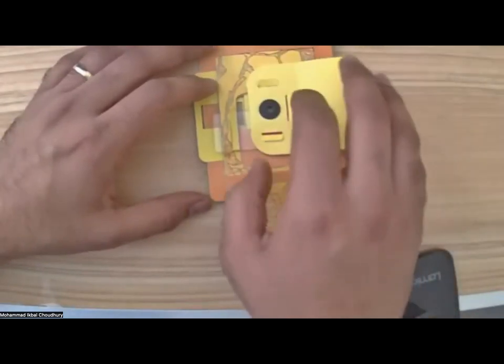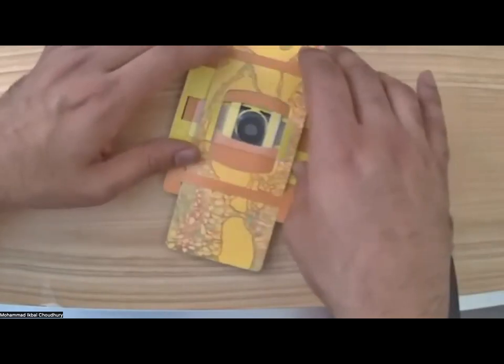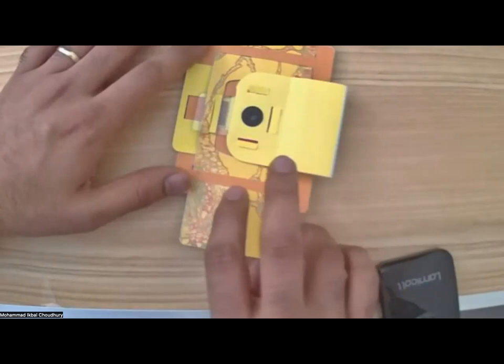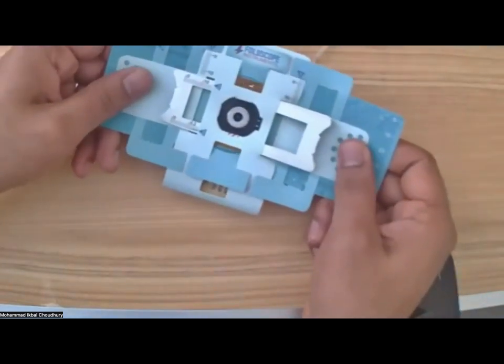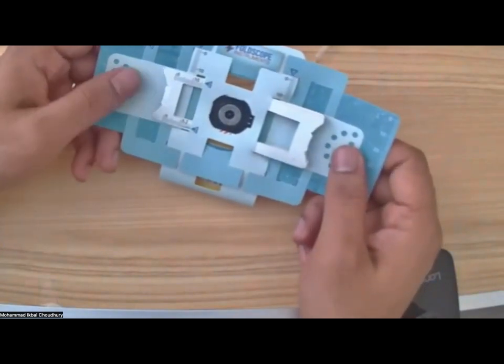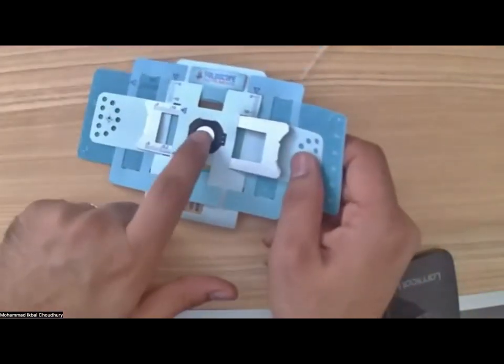You put it back like that, but then I have not aligned it. Let me see. I have to move it. Yeah. So the sample is here. I've aligned the lens and I put the flap back, and now it's time to visualize like this. Very easy. So I would practice without connecting your cell phone. Just practice to visualize any sample with your eyes.